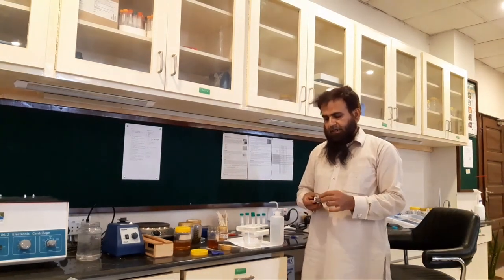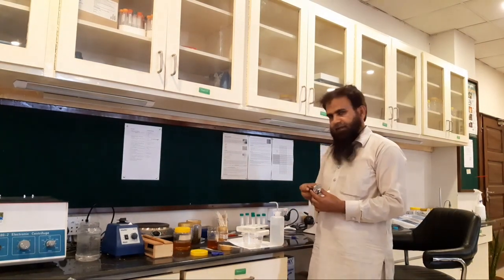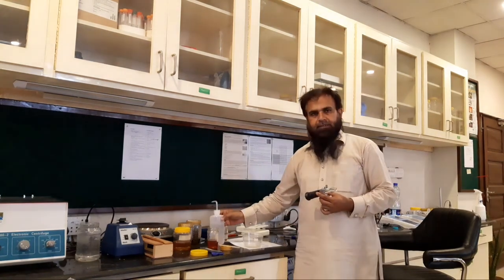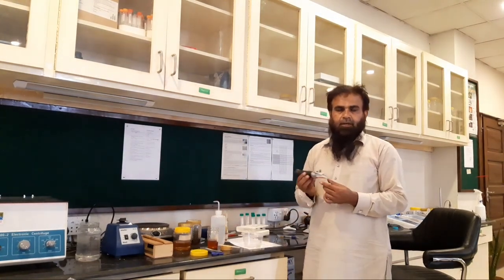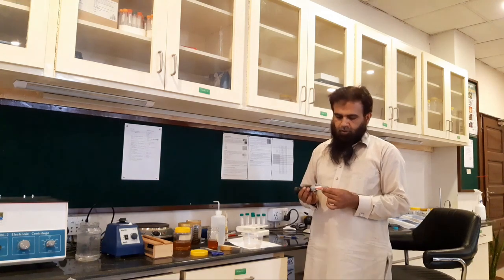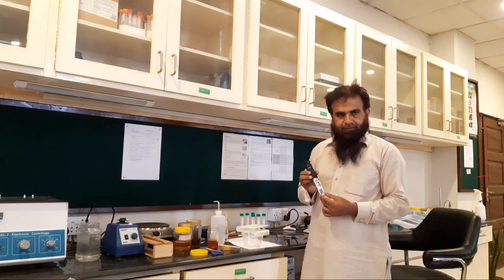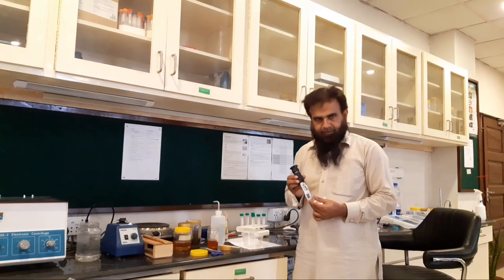This was all about the very important aspect of honey — how to determine the moisture content in honey with the help of the Atago HHR-2N Japanese Refractometer. Thank you very much.